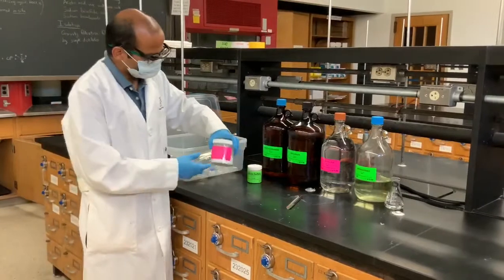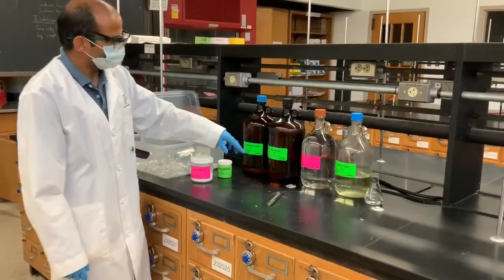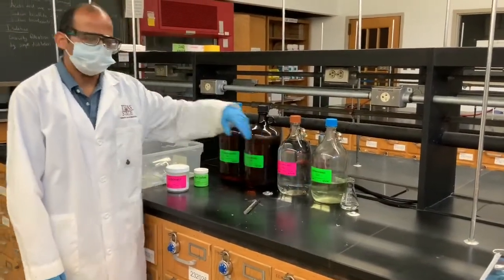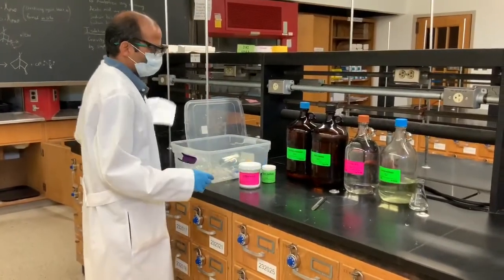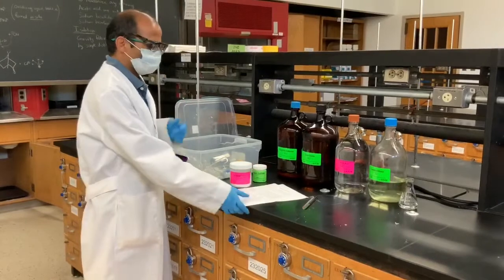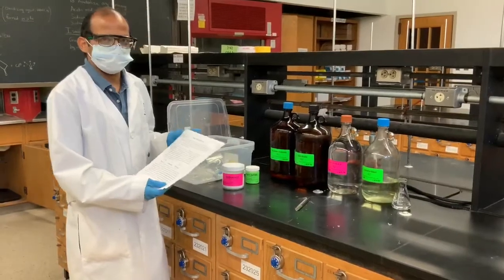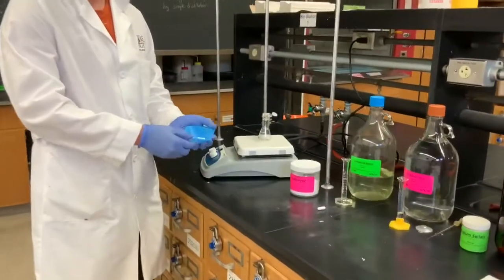To start this reaction, we are going to use isoborneol, sodium sulfate, saturated sodium bicarbonate, sodium bisulfite, glacial acetic acid, and commercial bleach. So now we are going to weigh the isoborneol. First, what we're going to do is add one gram of isoborneol.